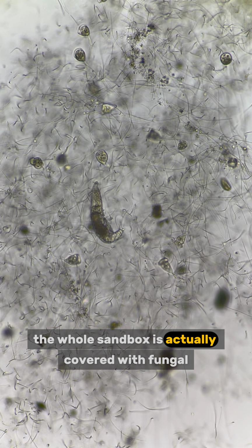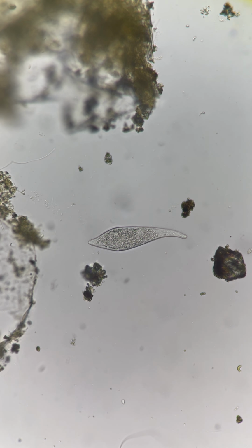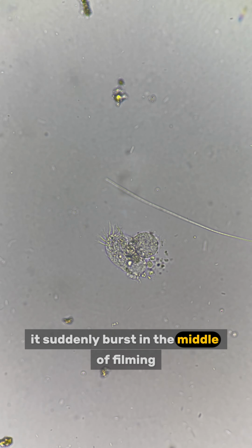The whole sandbox is actually covered with fungal hyphae. Other microorganisms are using them as shelter. Do you remember this? This is Dileptus. It is a predator that can touch and paralyze other microorganisms before ingesting them. Look at this tragic ciliate. It suddenly burst in the middle of filming.